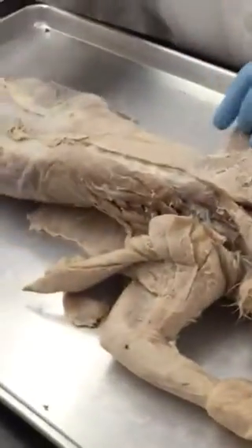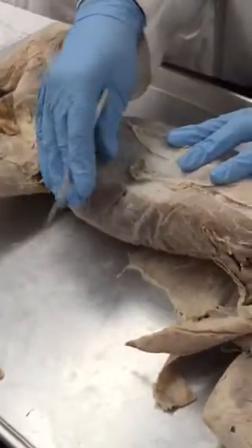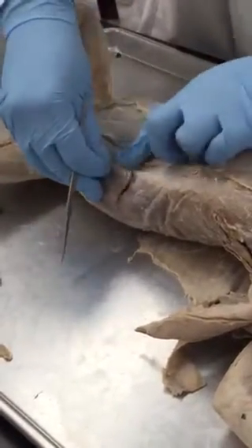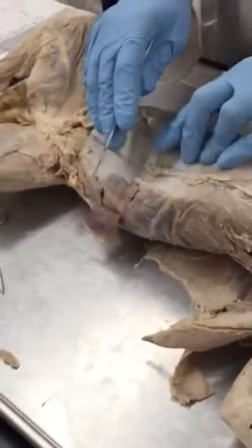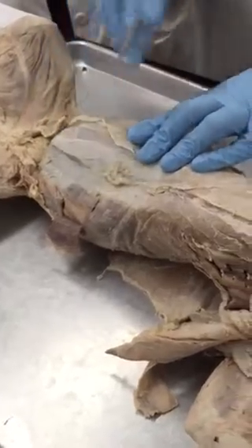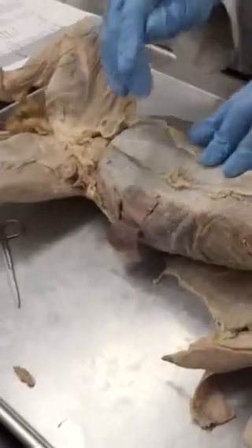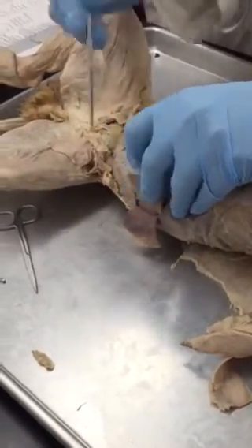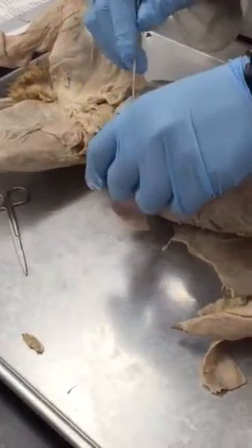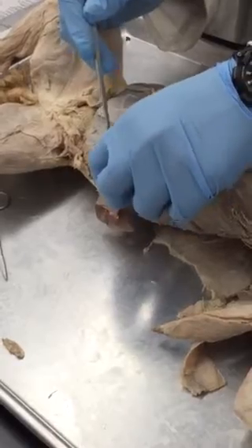So this was the dorsal side; now the abdominal side. The most external layer is external oblique. In the practical, always look for the number of layers. The second one should be internal oblique, and the third one is transversus abdominis.